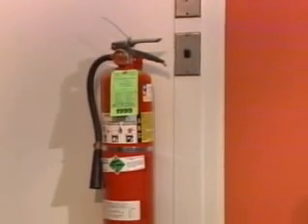It's a good thing that they knew where to find the fire extinguisher. Well, they should know where all of the emergency equipment is stored and how to use it. This includes the safety shower, fire blanket, eye wash station, fire alarm, and first aid kit.